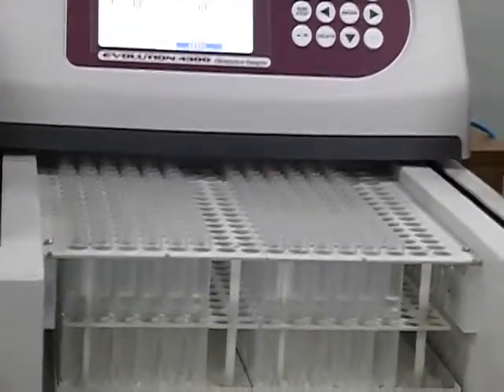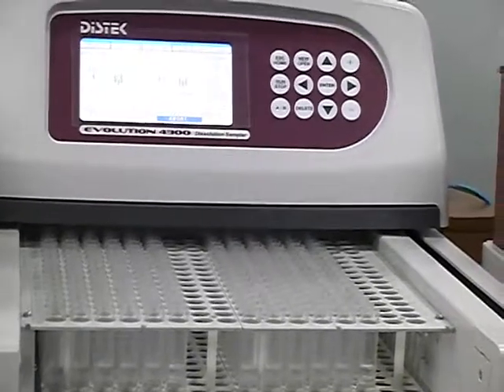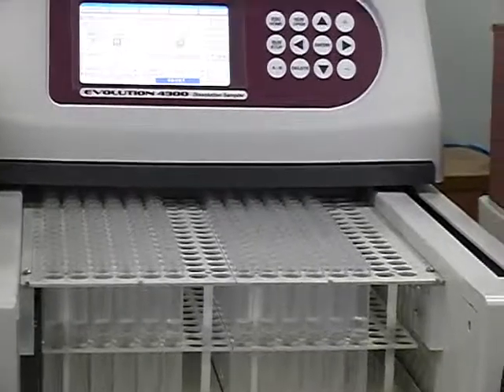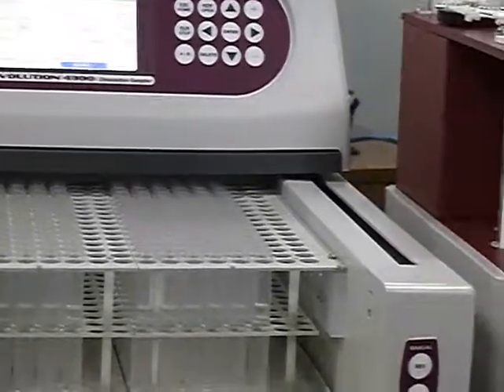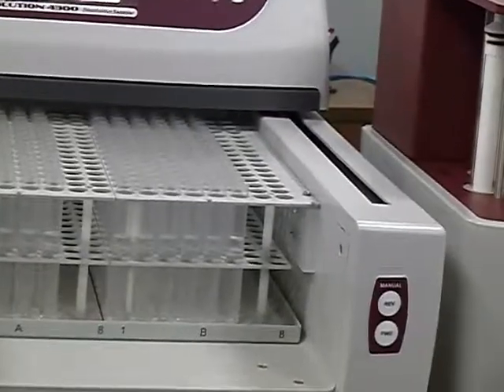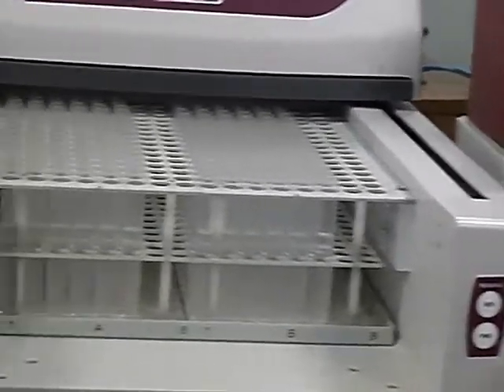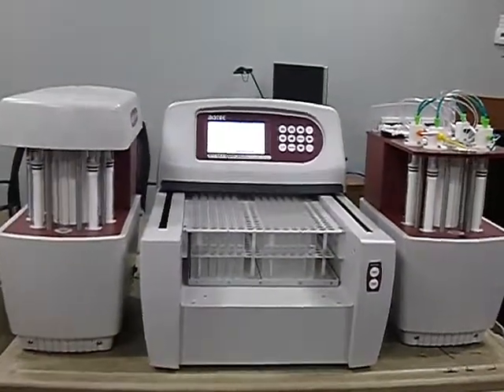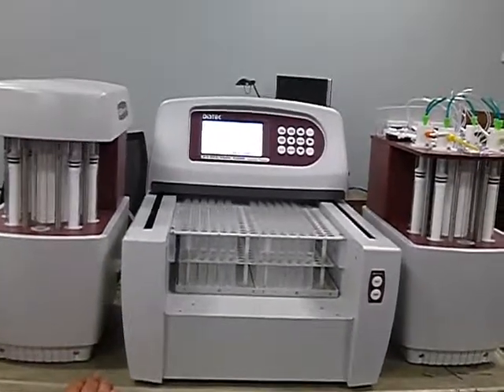OQ1 is where you're going to have both on. pH is very hard to fail. 250 mils. And that's why you have that 45 minutes, but actually it takes about 38 minutes and it's done. Sometimes I have to remember when to take the probes out to put them in the beakers, because that's quick.